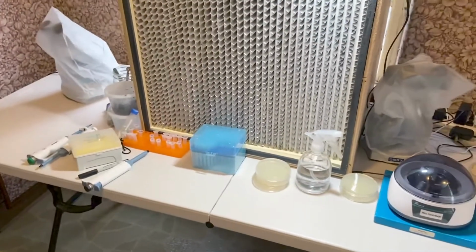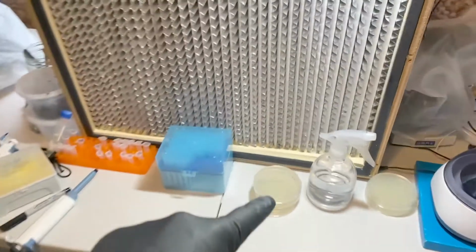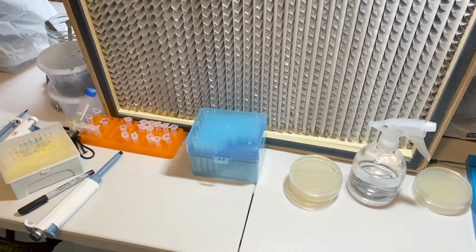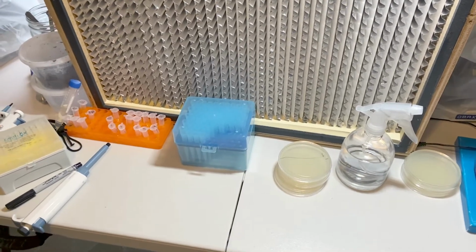So let me get those tubes going with the antibiotics and pick those colonies off, and let's see if we get any growth. If we do, that's great. That means the electroporation is working, and I just have a plate spreading problem.